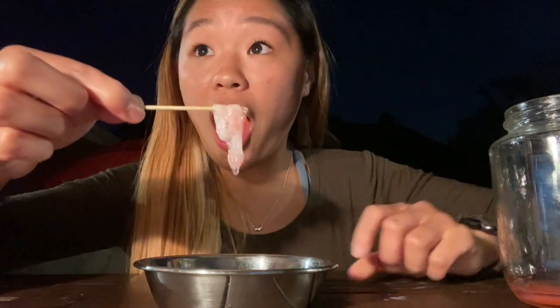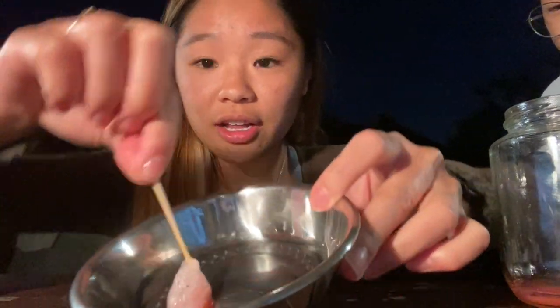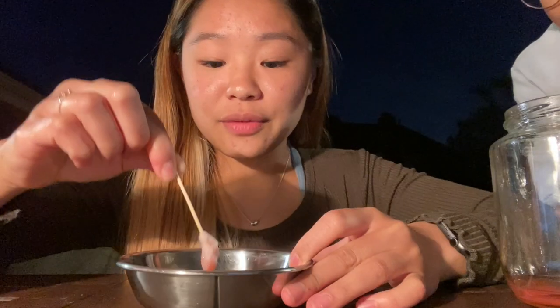This is really good! We're just gonna put it on our dish and we have our DNA. It worked — oh my goodness, look at that. So we're gonna look at this under the microscope.